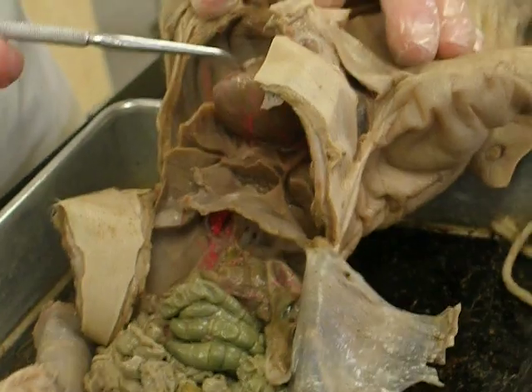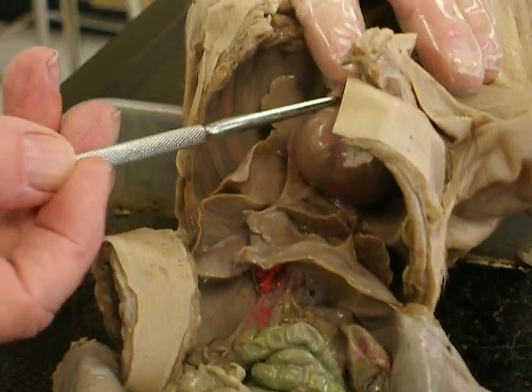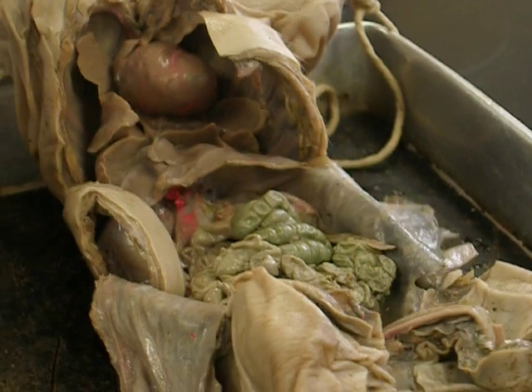This is the heart. The sac around the heart is the pericardium right here — part of it. The sac that I'm pulling up — that sac around the heart — that's the pericardium.